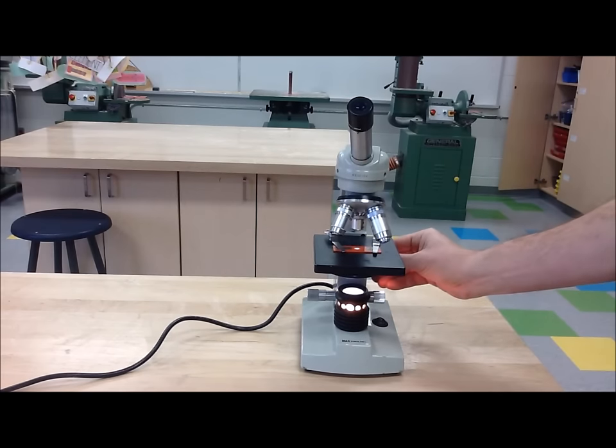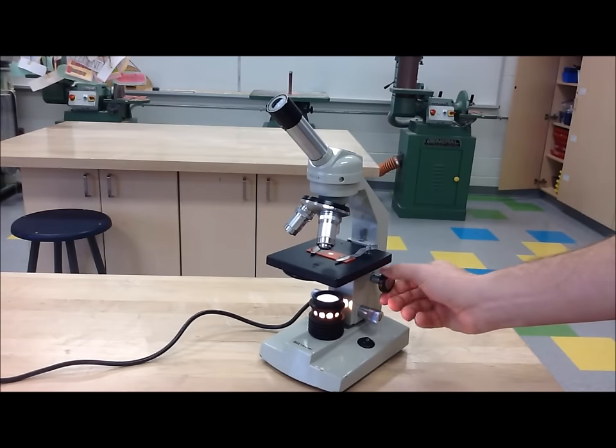Step 8: Carefully use the coarse adjustment knob to focus the image while you look in the eyepiece.